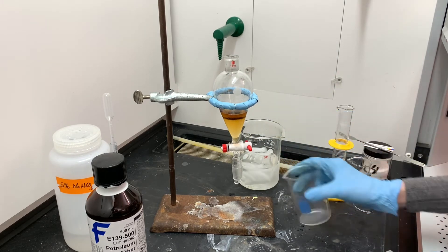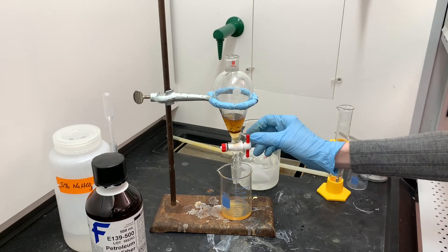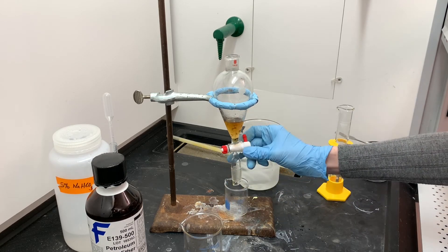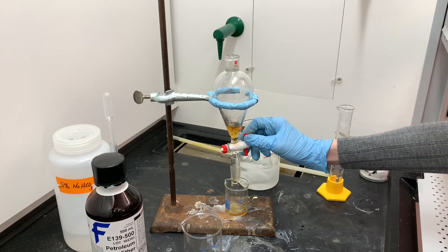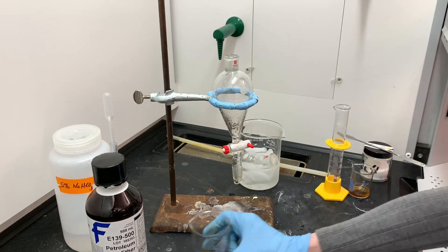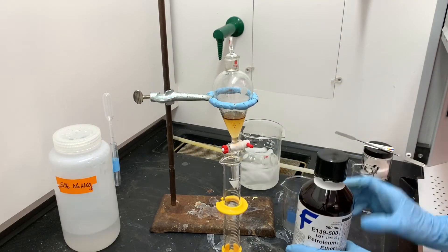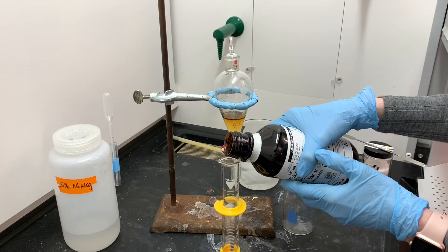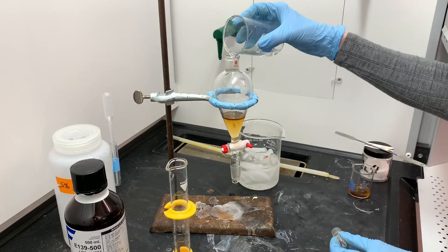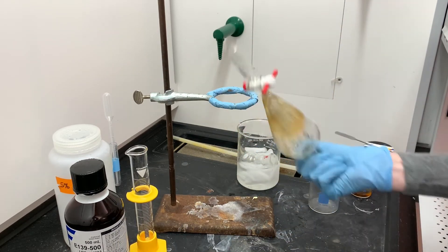Now that our layers are separate with a nice clean separation, I'm going to drain the aqueous layer first — that's the one on the bottom — and set it aside. I want the organic layer to be really pure, so I drained a little bit of the organic layer into the aqueous layer since I don't care if the aqueous layer is not pure. Setting the organic layer aside. Aqueous goes back into the separatory funnel with petroleum ether again for the second extraction — just to make sure all of the product is getting transferred out of the aqueous layer into the petroleum ether layer.